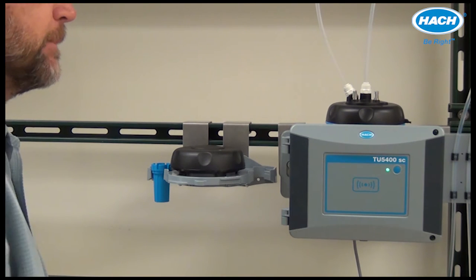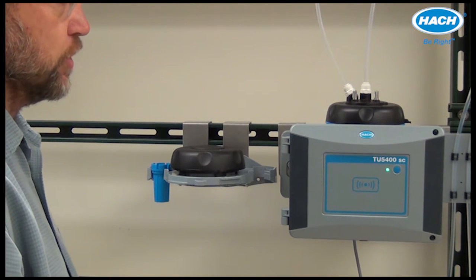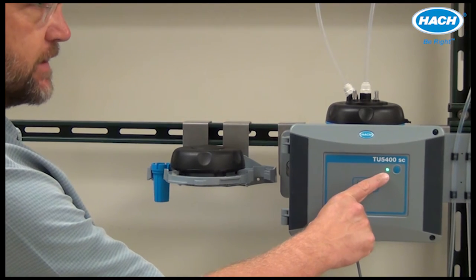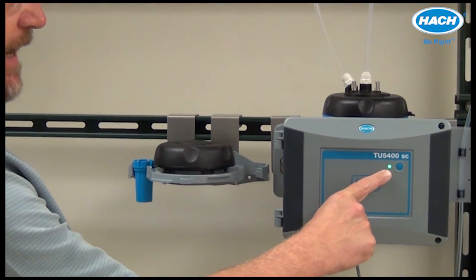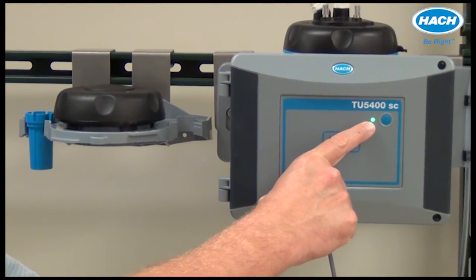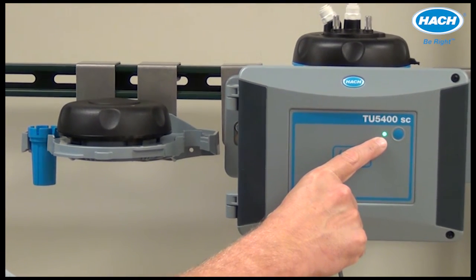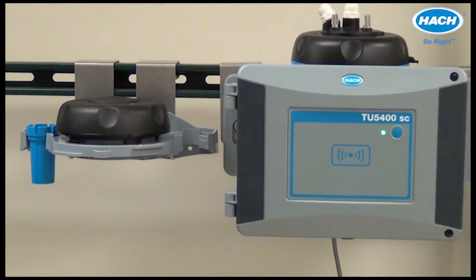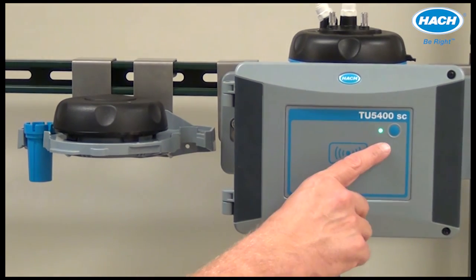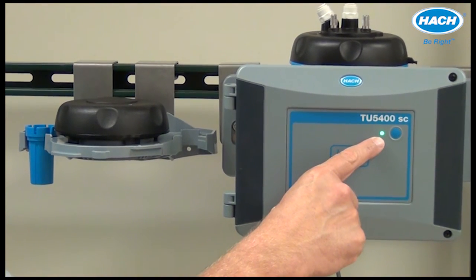When power is supplied to the TU5400 turbidimeter, one of four colors will be displayed on the status indicator light shown on the front of the instrument. The four colors denote the status of the instrument at the current time. For full details, refer to the instrument manual.